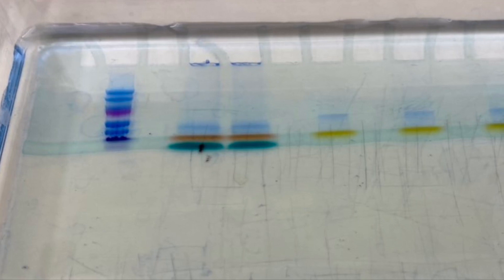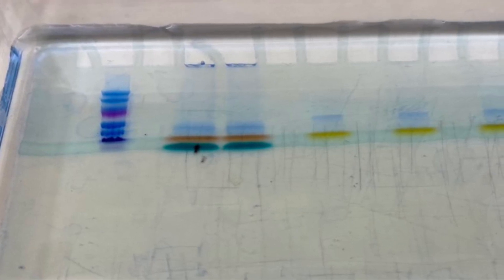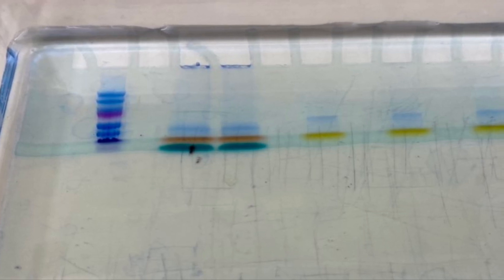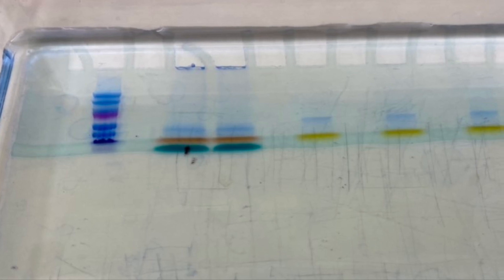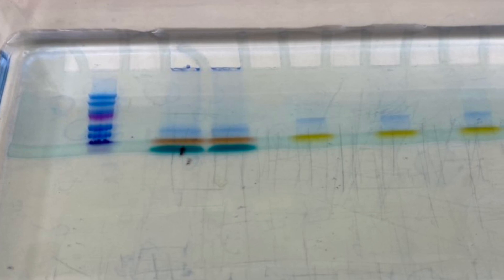So for this experiment I did run a very short gel. If you want super good resolution at the end or you just want to see a specific band run your sample until the very end but you will need to cut it in around 10 pieces. Otherwise you will not be able technically to do the sample prep step.